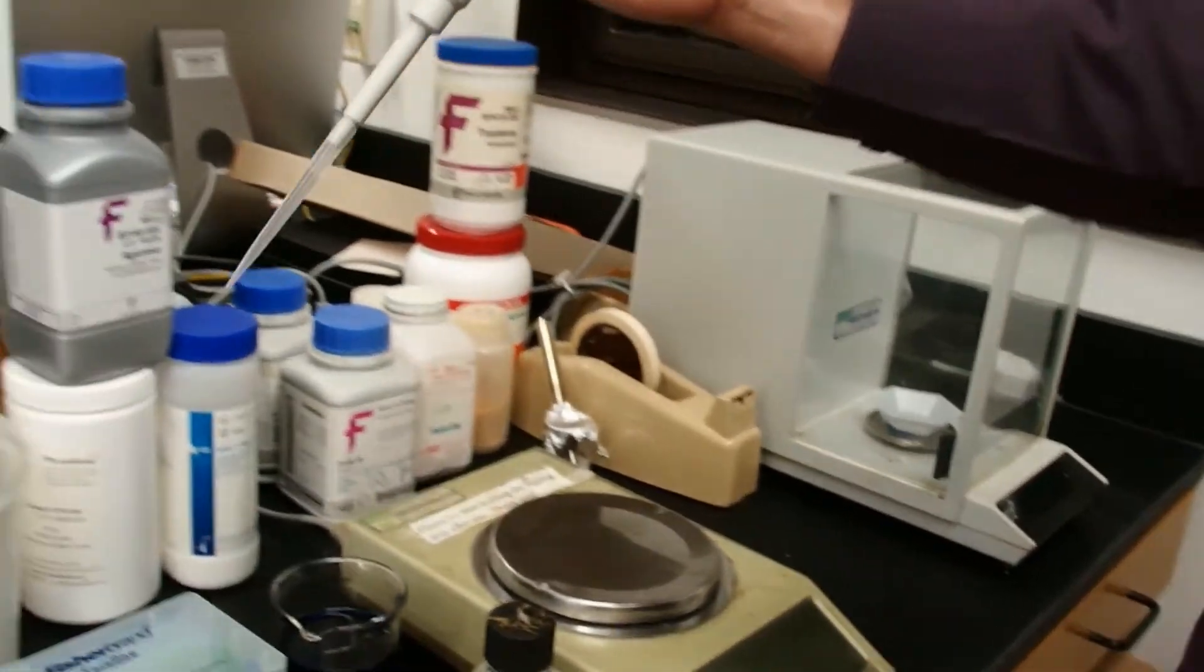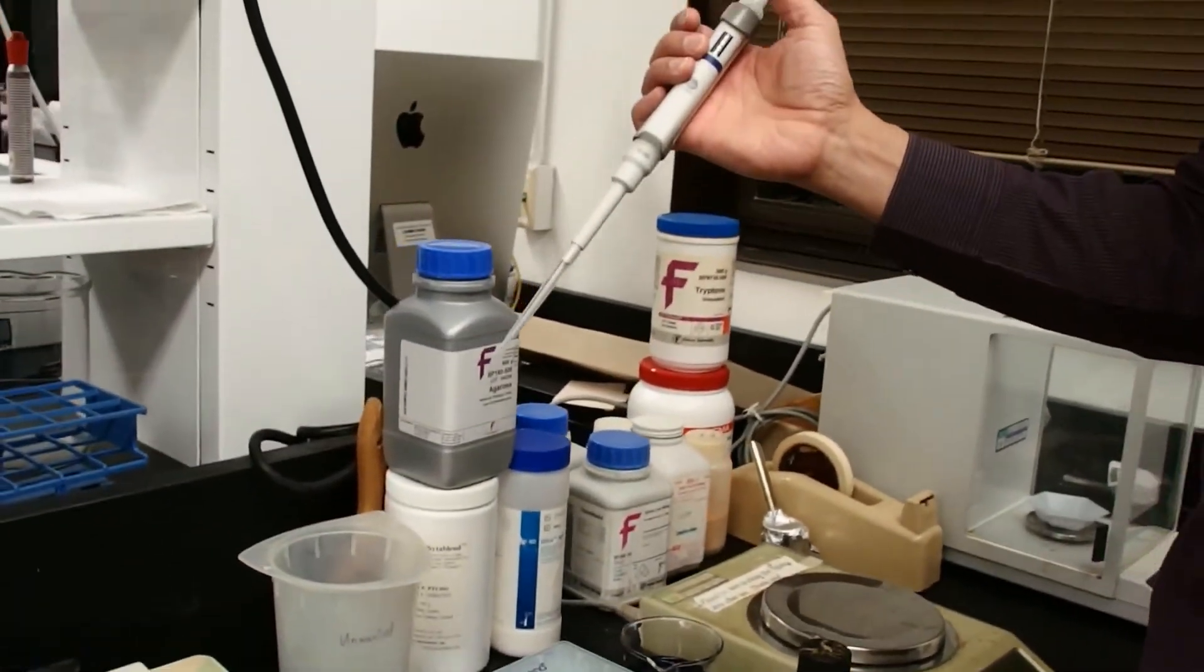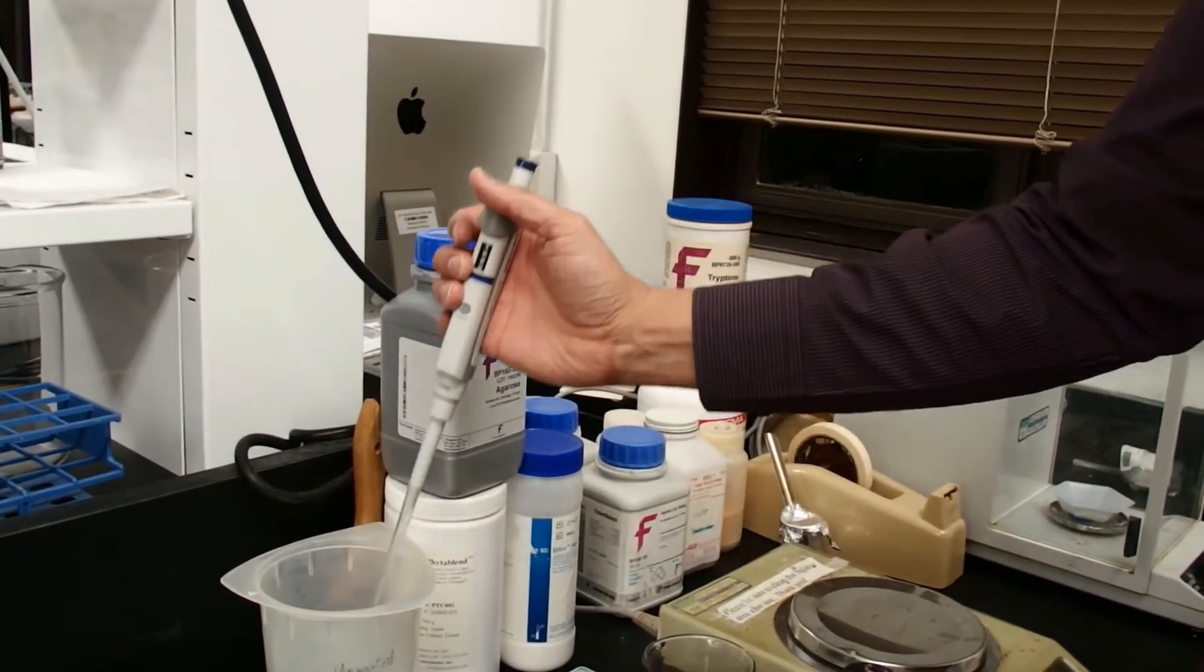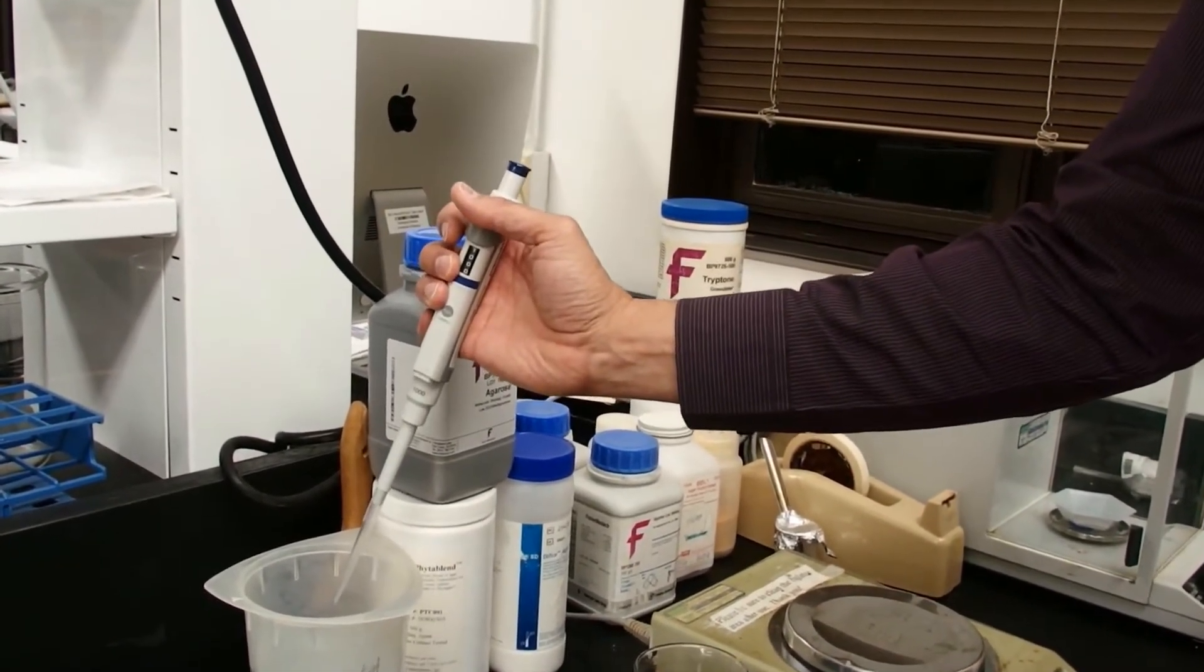Finally, after we use the tip, we want to eject it. To eject it, you press this button here into your waste bin.